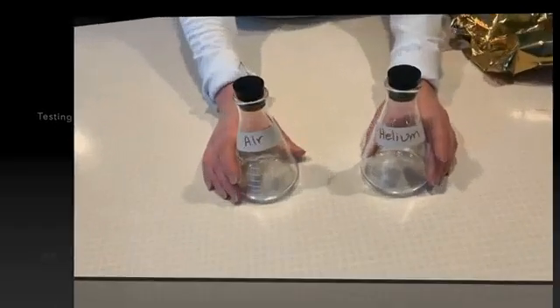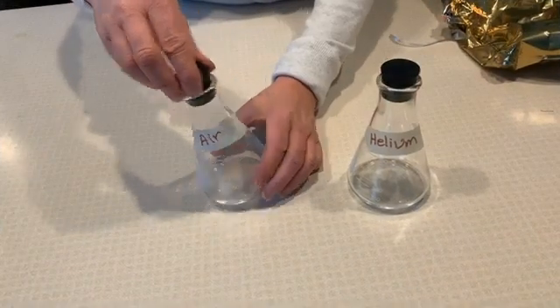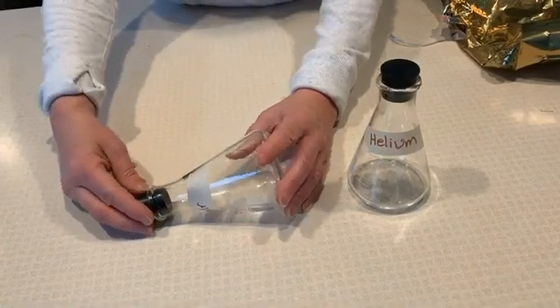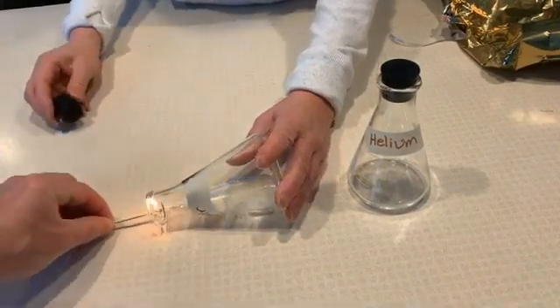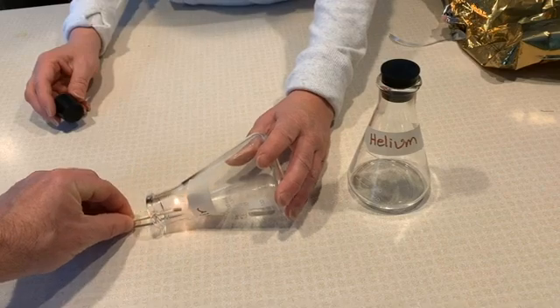Testing the flammability of air and helium. We'll test the flammability of air first. She turns the air flask sideways. An assistant strikes a match and inserts it into the flask — it remains lit.